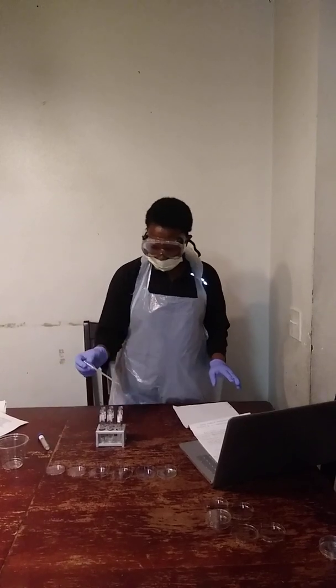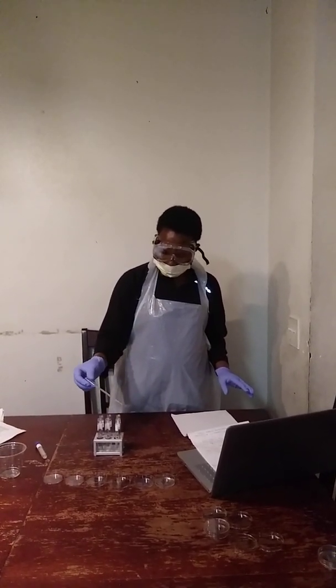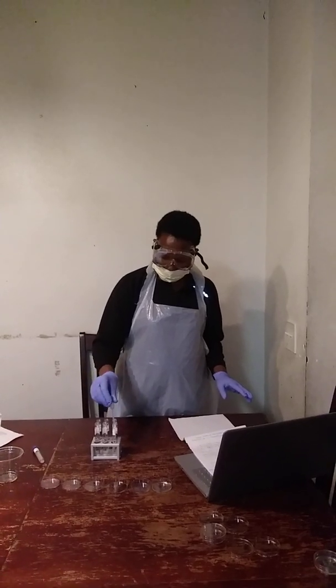And so for me, I will transfer this solution to my agar plates.